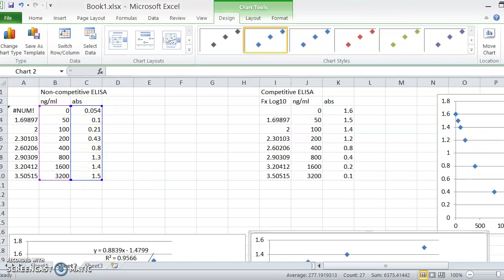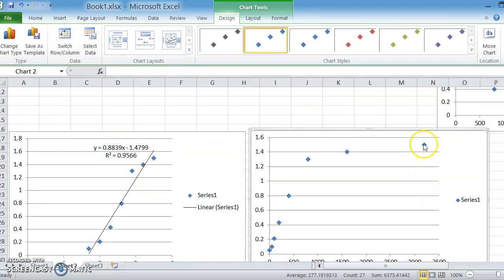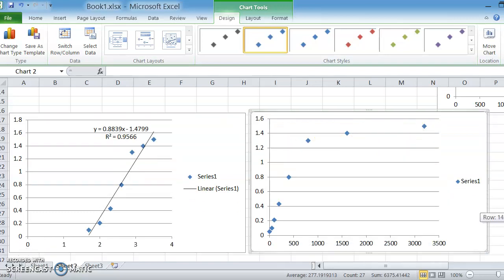If we plot that data, we will get a graph that looks like this, which is quite difficult to read off, and what you can see is this graph is also plateaued, but you've got a lot of data points down here. Now, this graph is not ideal because each data point, as we move this way, the distance between each data point doubles. Now, if we want to make that into a straight line, we can plot it, instead of being a linear scale down here, as a logarithmic scale.